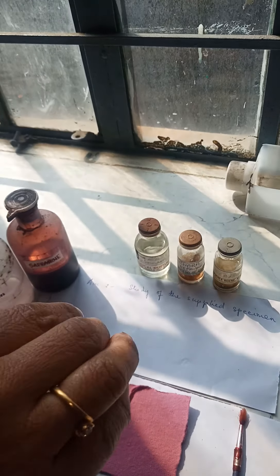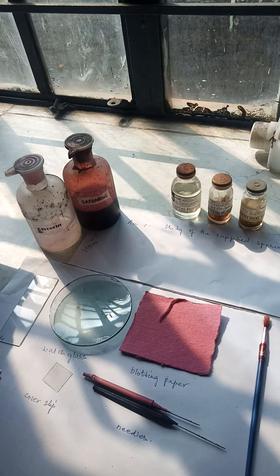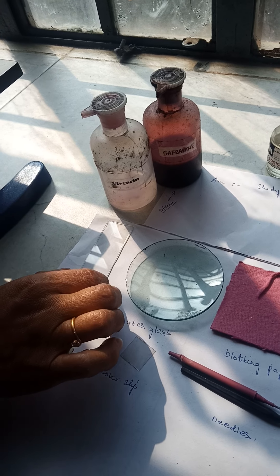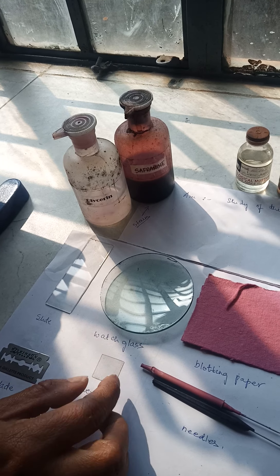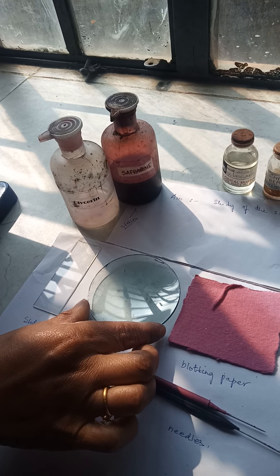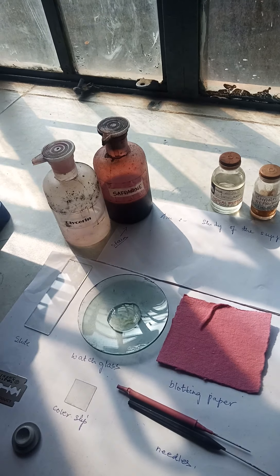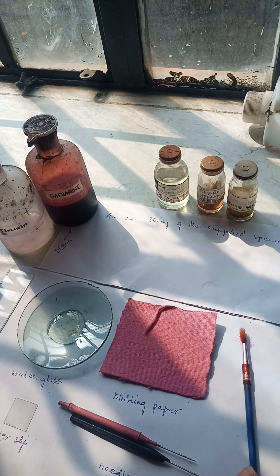Whenever you come to the lab to do the practical, you will need these items. First, you will need a slide, which will be supplied from the lab. The lid placed on top of the slide is called a cover slip. You also need a watch glass, which we fill with water so that when we take out the specimen we empty it into the watch glass — that is the purpose of the watch glass.